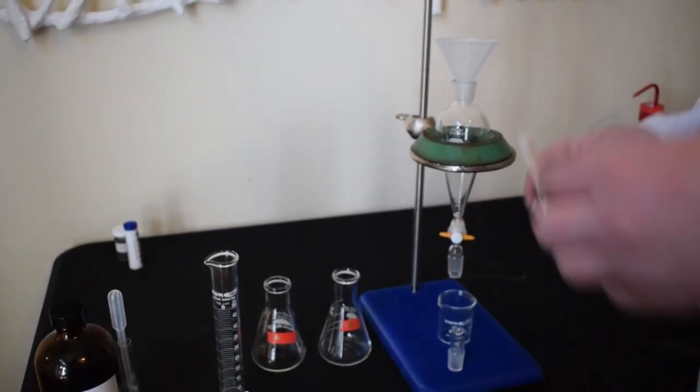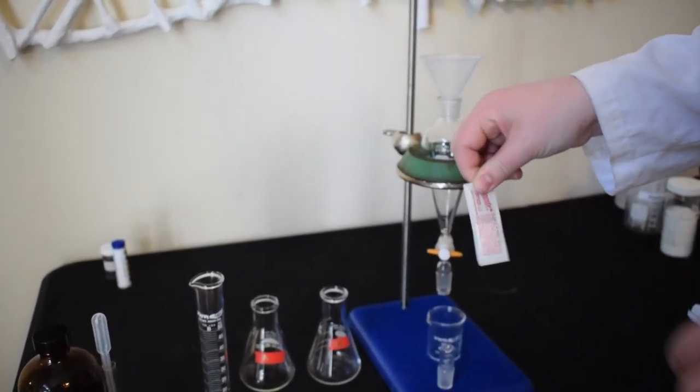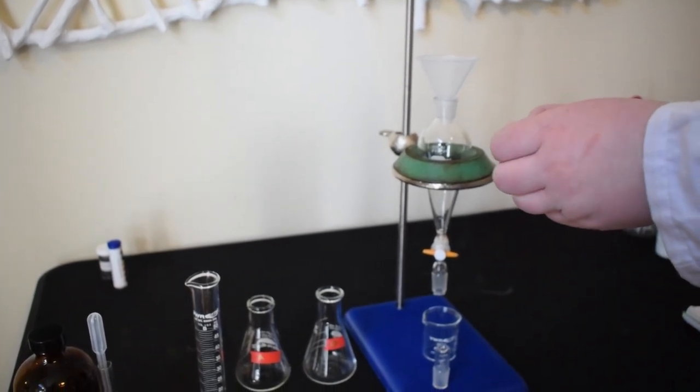All right, you guys, we're going to go ahead and get started with our liquid liquid extraction.